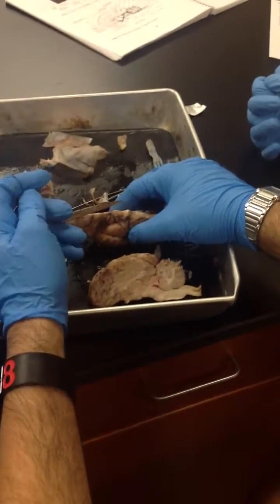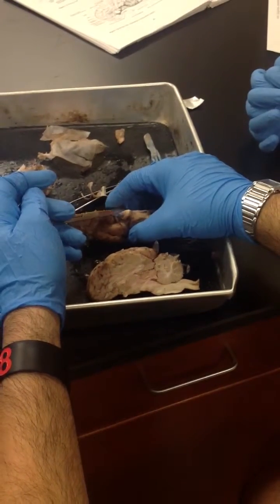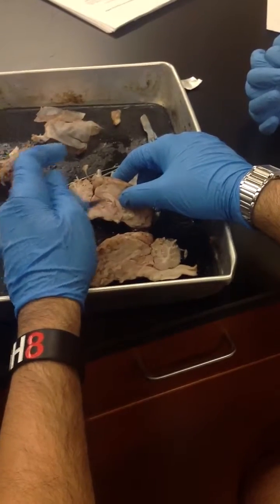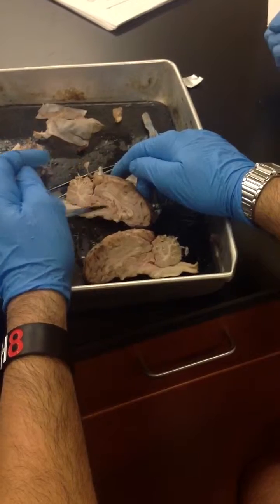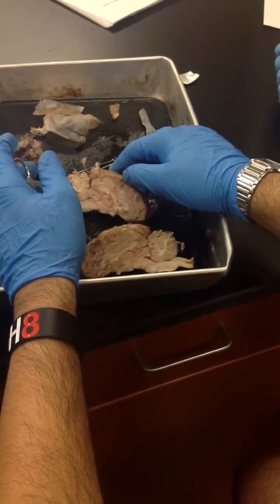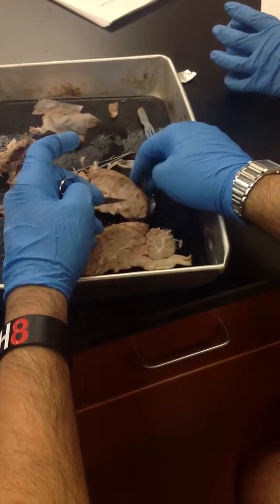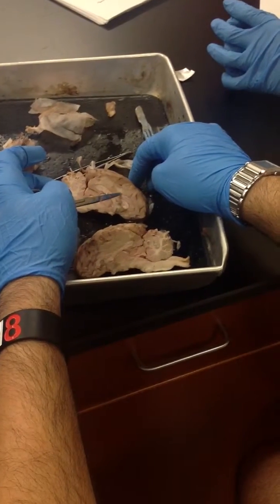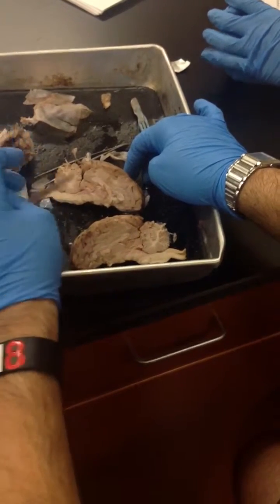What about the midbrain? The midbrain, you don't need to know those terms for the test. No, you just need to know the structures. Midbrain, hindbrain, and forebrain are like the regions of the brain. So you don't need to know that for the practical. The practical is just going to have little pins. So one would be here, it'd be arbor vitae. If it were here, it'd be thalamus. If it was here, it'd be corpus callosum. If it was here, it'd be cerebral cortex, cerebrum, or cerebral hemisphere. They're the same terms for the same thing.